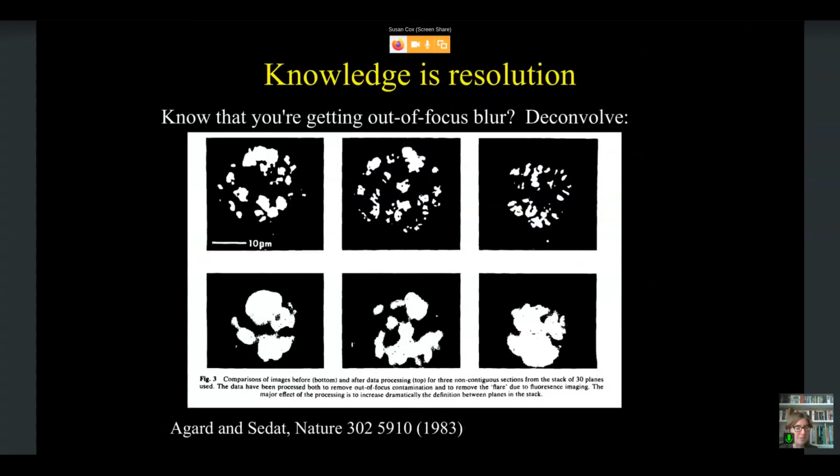Now, localization microscopy is one example of a more general class of techniques where we can exchange knowledge for resolution. So this goes back all the way to the 1980s, where people first started to use image processing for improving microscopy images. And this is an example from back in 1983 by Agard and Sedat, where they used images of a zebrafish embryo, and I show the unprocessed images on the bottom, and they used the fact that they knew how out of focus light propagated through the sample, and they were able to remove out of focus light from the images and get back images that were much sharper.